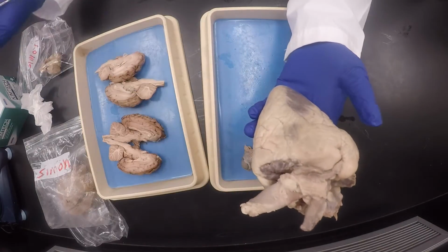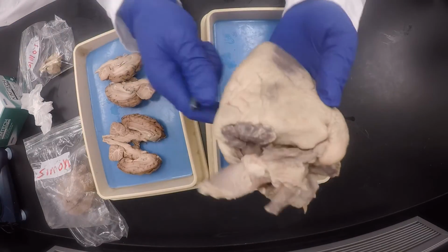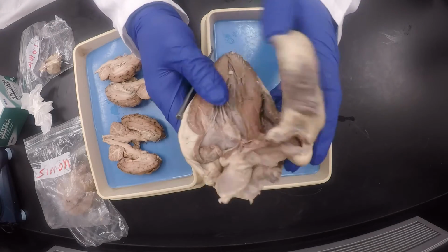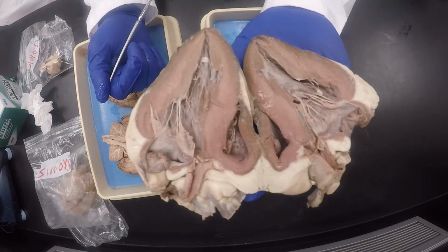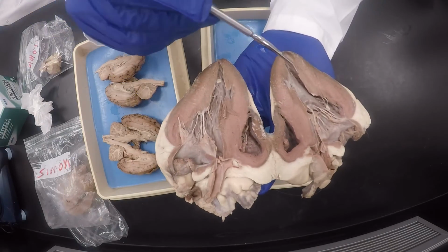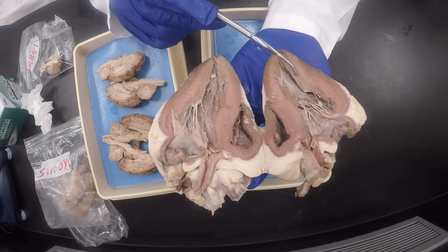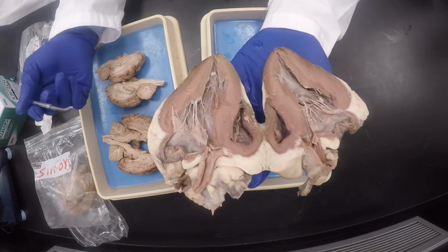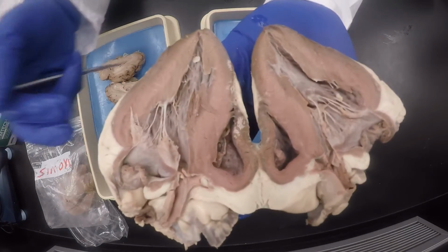Okay, so those are the four great blood vessels, and those are the exterior stuff, and the interventricular groove, and the auricles. You have to say left and right, by the way. Then you cut from the left side, then voila, you've got a bunch of internal structures. Oh my god. Okay, so the part that includes the apex and is the bigger is the left ventricle. The smaller one is the right ventricle. Okay, so you don't have to keep flipping back and forth to see which side is which.